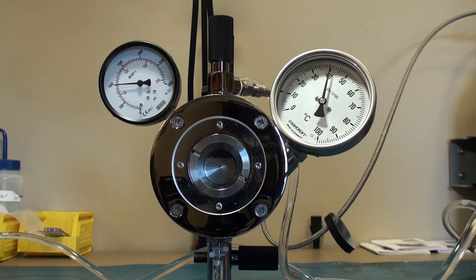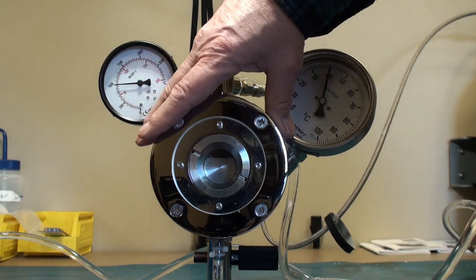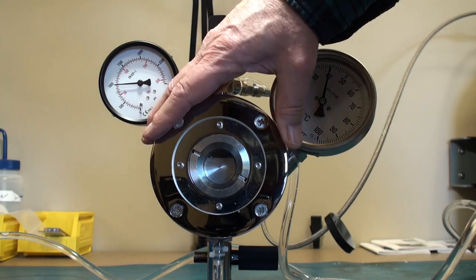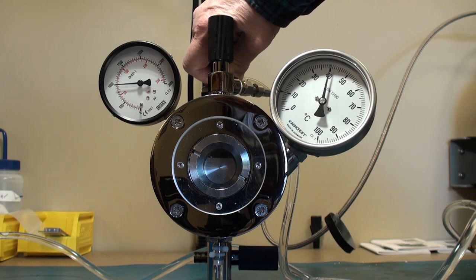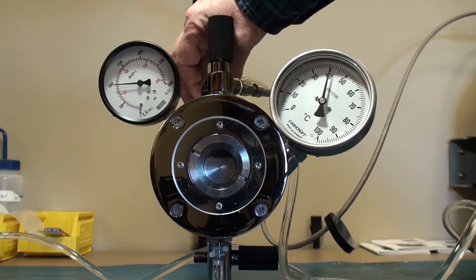I've shut the recirculating pump down because we're still at 40 degrees. Like I said, this is thermal mass, difficult to get cold. And once it gets hot, it stays. You can hear that as the amount of gas coming forth from the exhaust changes. And this is where it requires some monitoring.